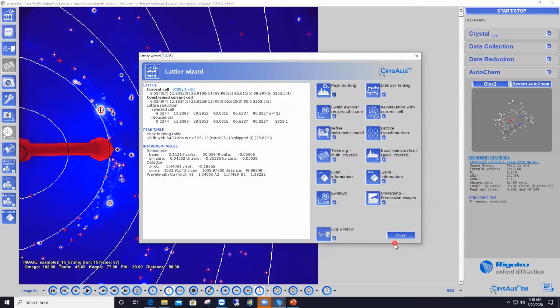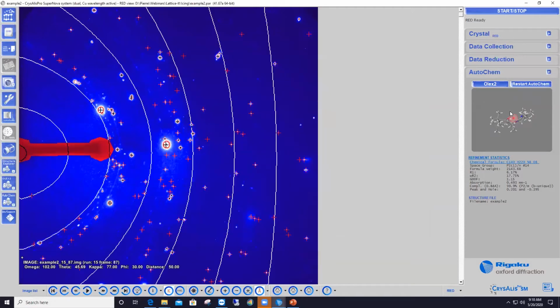The other thing I want to show here is that the structure you see on the right-hand side was obtained via automatic analysis of that data set. That means automatic processing, automatic indexing, and automatic structure solution. So CrysAlisPro does a really good job with this very icy data set because there are enough crystal reflections that can be distinguished in this case from the ice features.